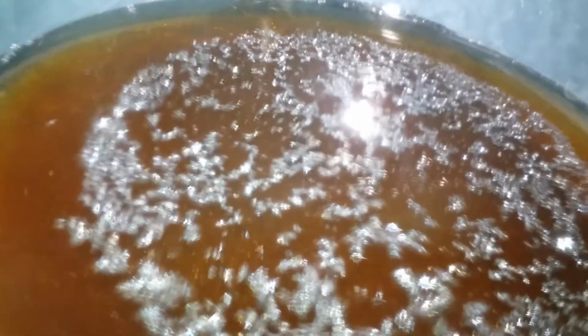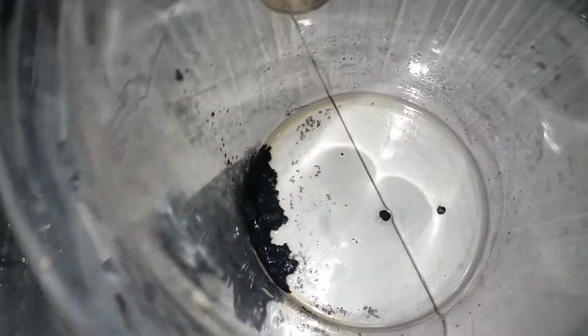But on the bright side, the filtrate is trying to crystallize out. As you can see, the shiny crystals are, wow, they are beautiful. Okay, so it's not gonna focus. So now more iodine is trying to crystallize out, which means more product. Well, good. So here I have more.